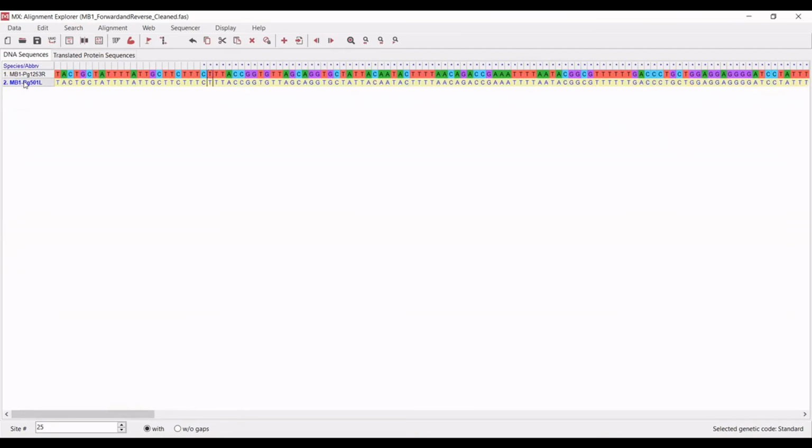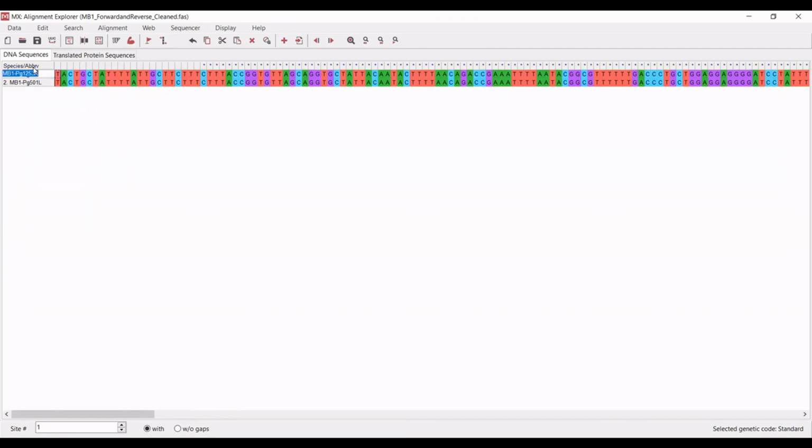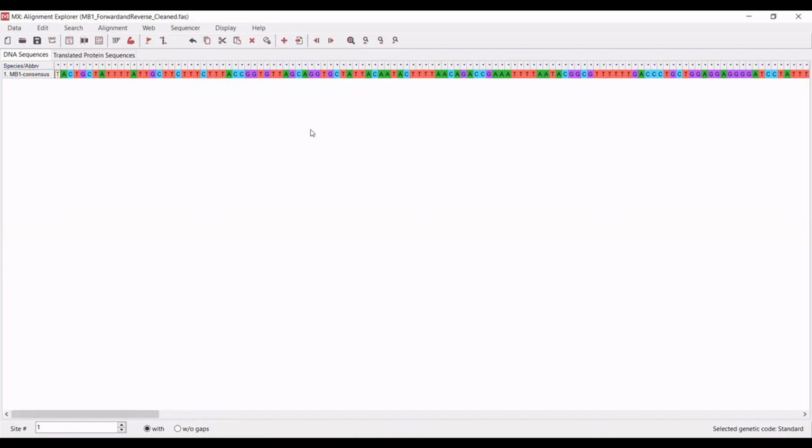And then what you can actually do is you can rename this to be the consensus, and you can actually delete the other one. And that just keeps your alignments, your phylogenetic analyses a lot smaller and a lot more efficiently run. And so that's what I would recommend. Ideally, after you input all of your sequences, you would have quite a big sequence alignment file here.